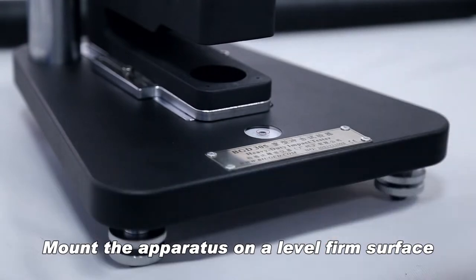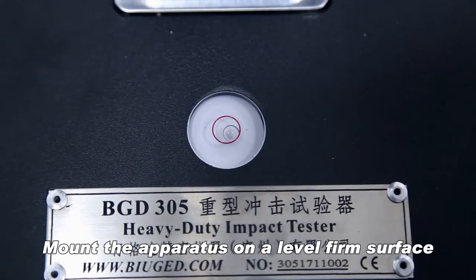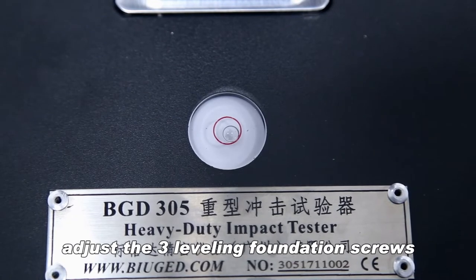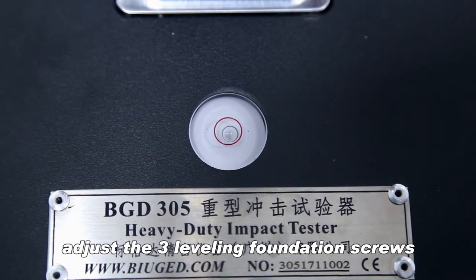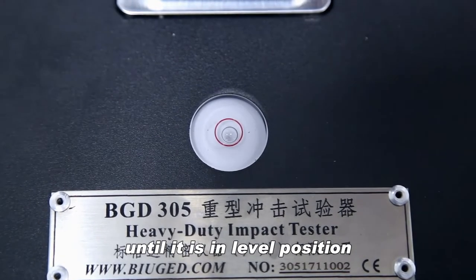Mount the apparatus on a level firm surface. Adjust the three leveling foundation screws until it is in level position.